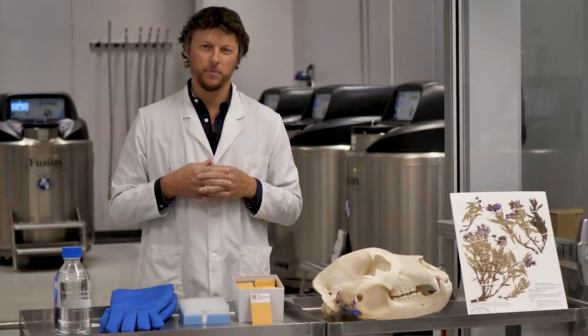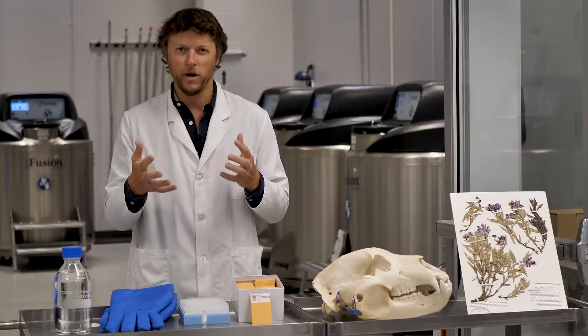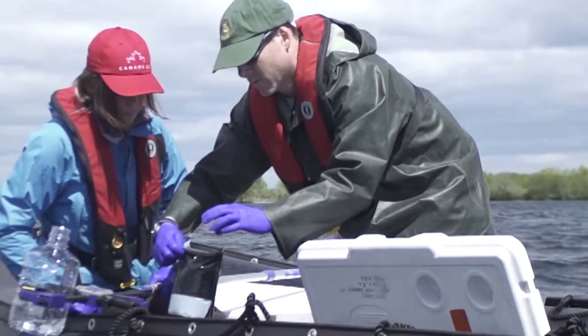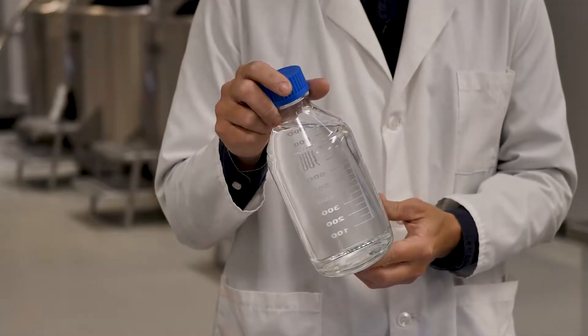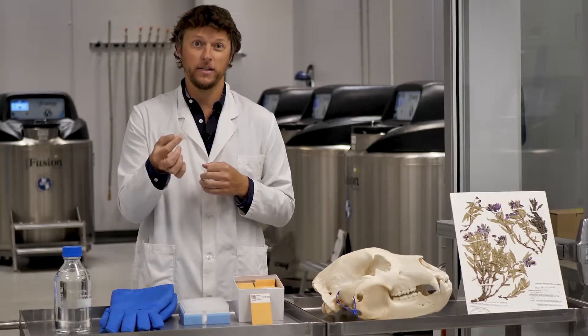We also have one other type of sample here, and that's called environmental DNA, or eDNA. Imagine you're in the ocean with all the animals, plants, and aquatic microorganisms — all of those organisms are shedding DNA constantly, and that DNA floats through the water. We can capture it by scooping up a liter of water, then concentrating the DNA by pumping it through a filter like this one here. That concentrates the DNA onto the filter, which becomes our eDNA sample — a DNA fingerprint of all the organisms in the ocean at that time.